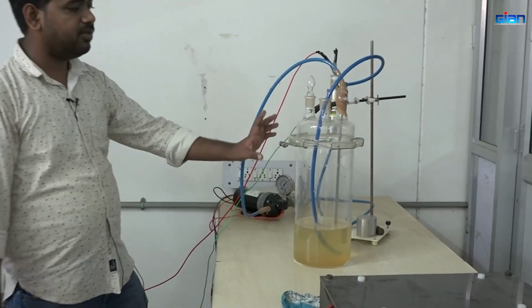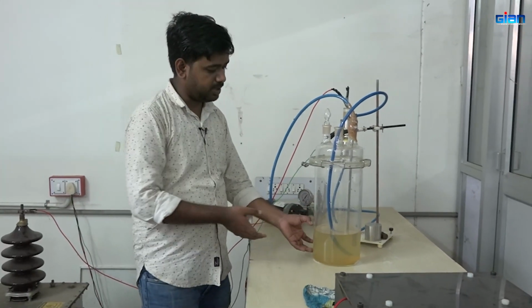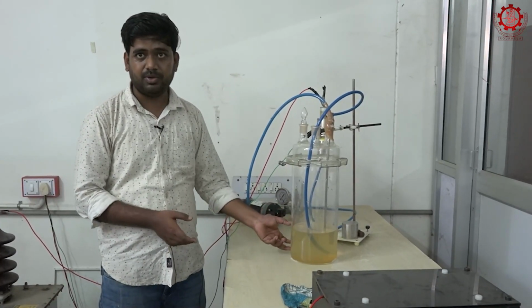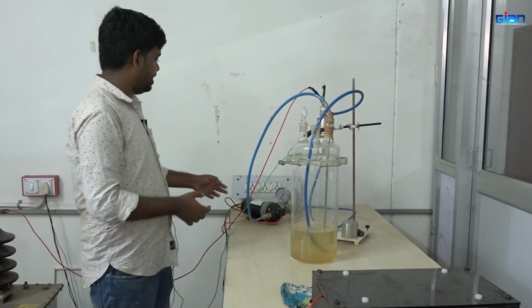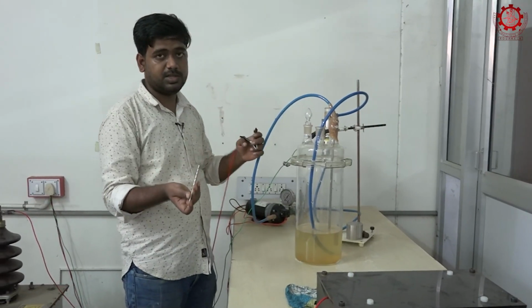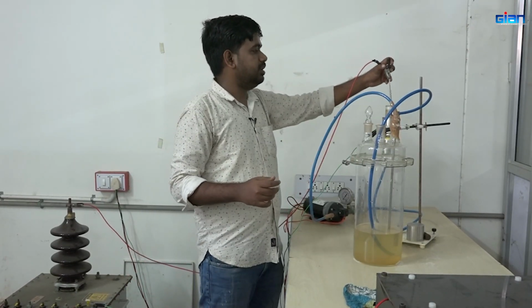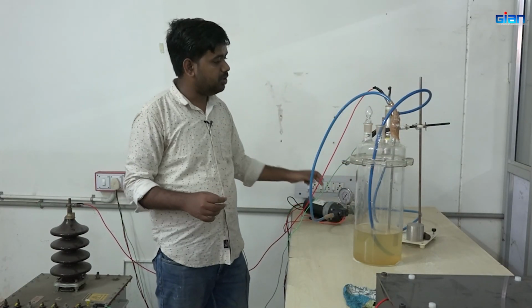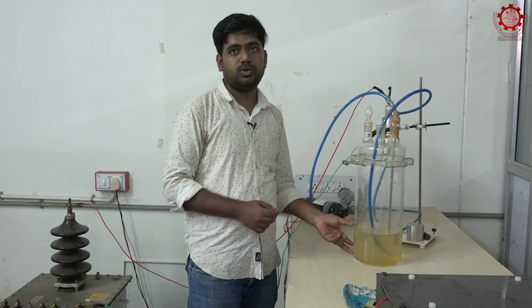See, this is the basic setup for plasma activated water, where you can see this is a glass container where we are putting the water. The minimum recommendation is that 1/3 of the total volume should be filled with water before we start the plasma activated water. The maximum we can fill as per our choice. There is only one electrode for this plasma activated water. When you apply the electrical current, plasma will be generated and it will dissolve into the water, and then this pump will be recirculating the water. As a result, whatever water is there will be a rich source of plasma.